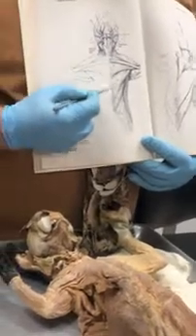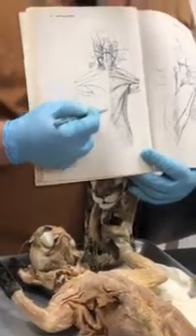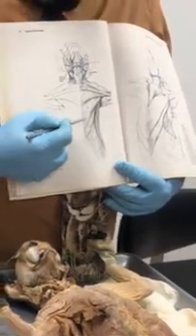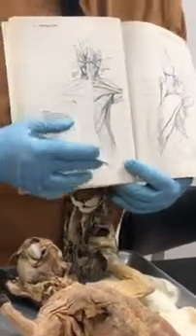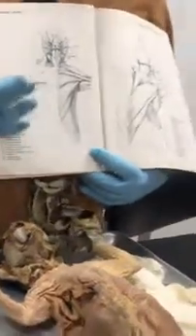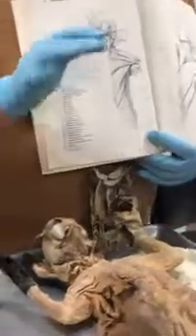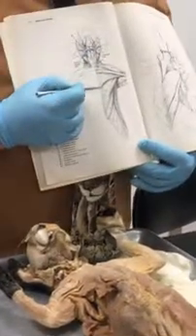Below that, a larger one, weird, but the larger one is called the pectoralis minor. And the minor is larger than the major because the cat is lifting up more, it's holding more of its weight on its arms, right? So things have been adjusted, or adapted, because of that.